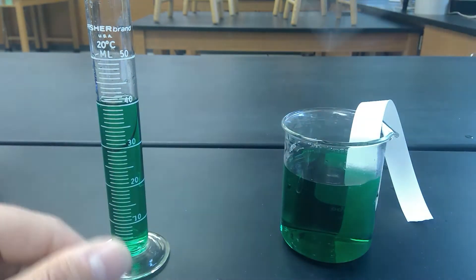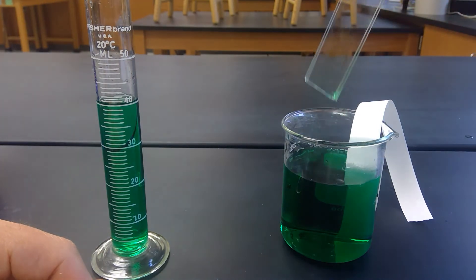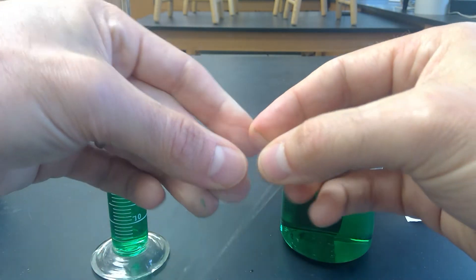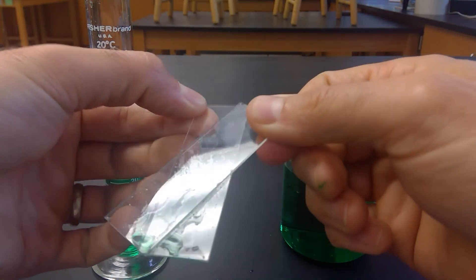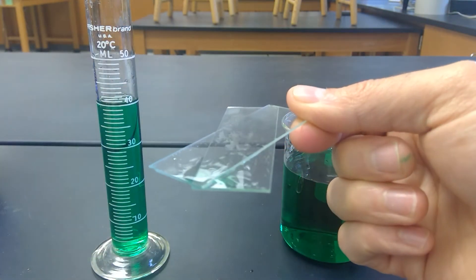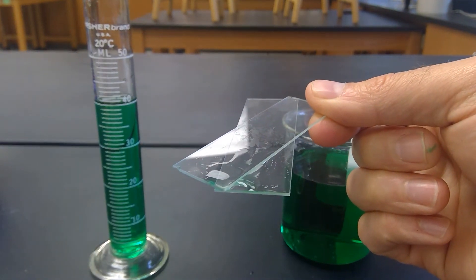If I then take these two glass slides and put them into the water and take them out, now to be able to pull them apart takes a lot more effort. And actually I can hold this one like that and it's going to hold the other slide together. That's adhesion.